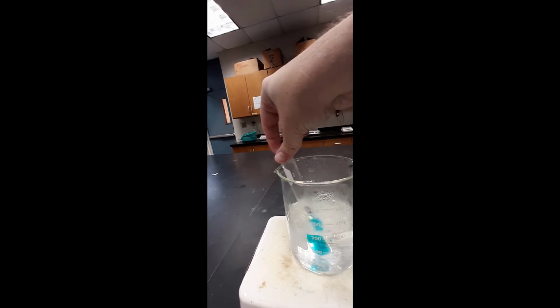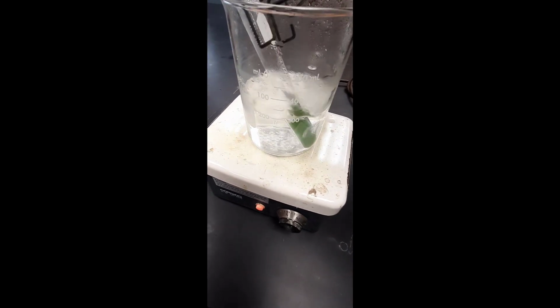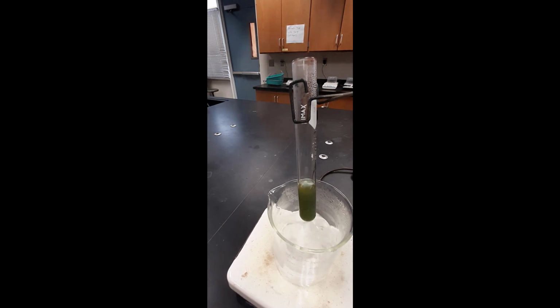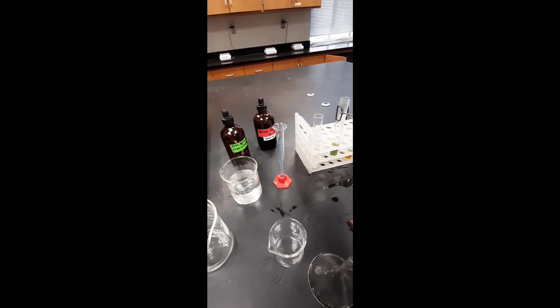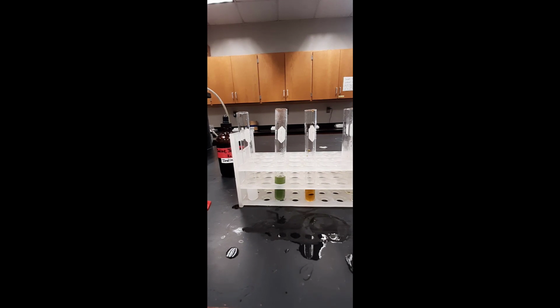I take the combined solutions and add them to a hot water bath for 5 minutes. After sitting for 5 minutes in the hot water bath, we clearly notice a transformation. Now, this doesn't look like we might have expected for a positive test. However, for the solution to have changed in any way must suggest that some of the glucose must have escaped the bag. So, although this is a somewhat anomalous test, I would still consider it positive.